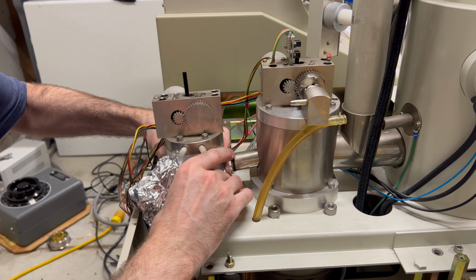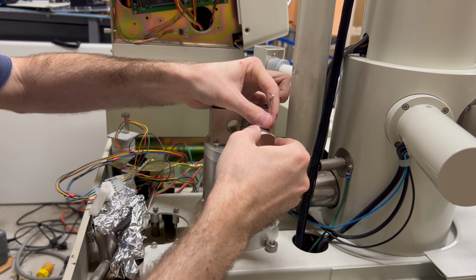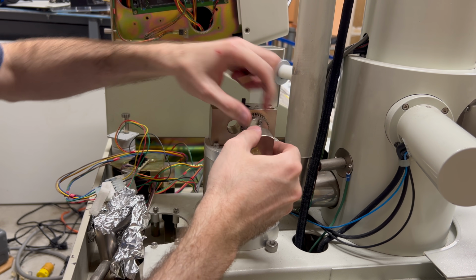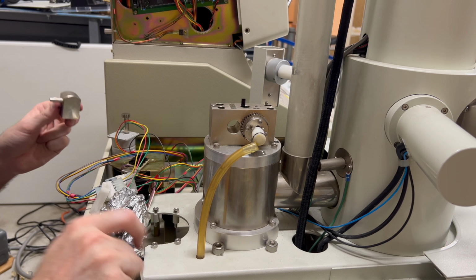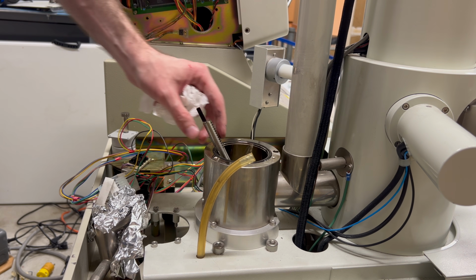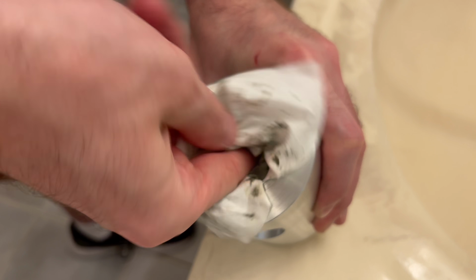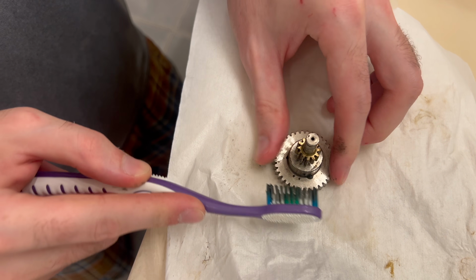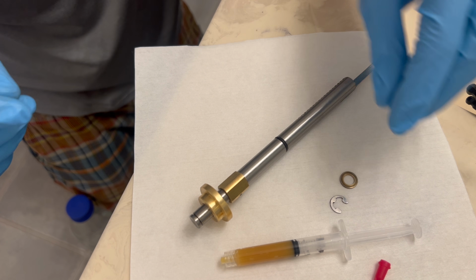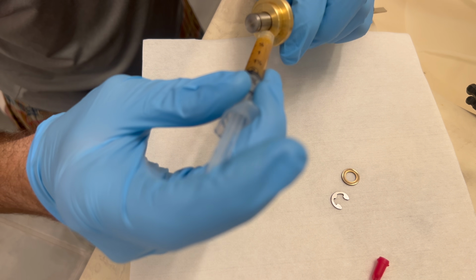I powered down the SEM and waited until the diffusion pump was back at room temperature. Then I proceeded to tear down the entire vacuum system. The two large valves near the column are responsible for switching between the rotary pump, diffusion pump, and venting the chamber. I slowly and methodically took everything apart and cleaned the valves with acetone and isopropanol to remove all the 30-year-old residual gunk. Then I lubricated all of the moving or sealing surfaces using Apiezon L high vacuum grease.